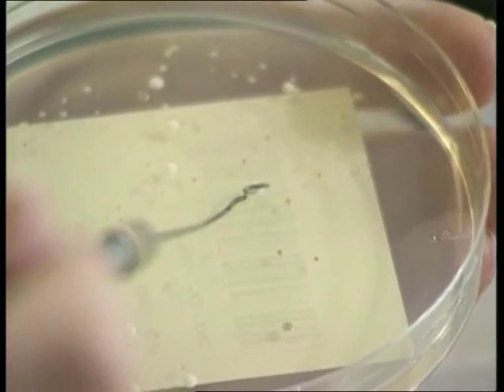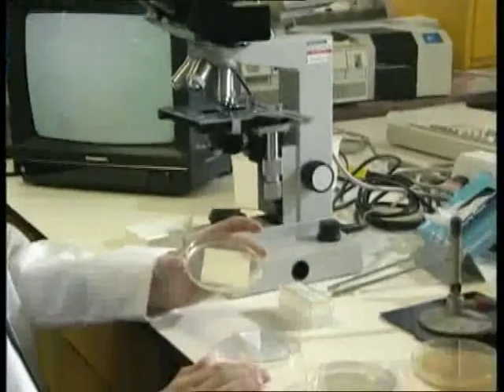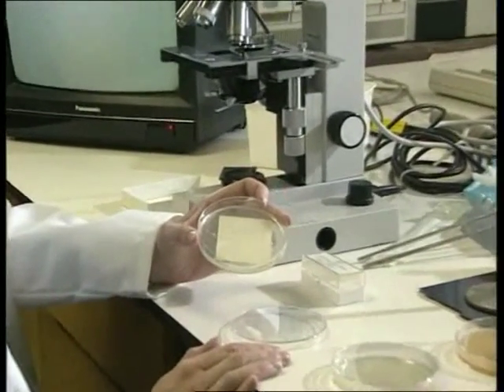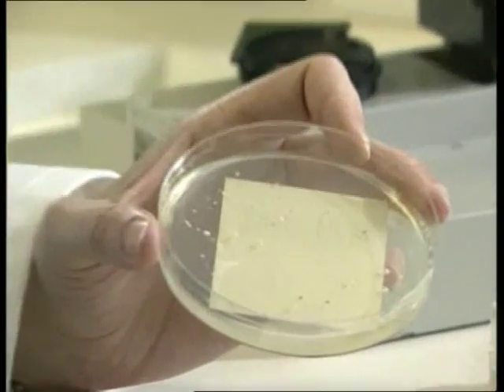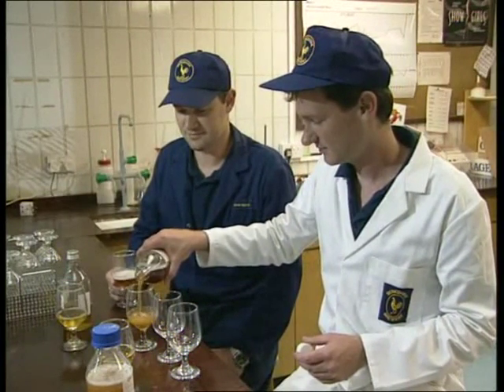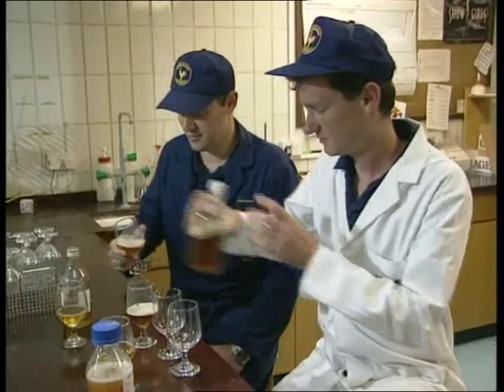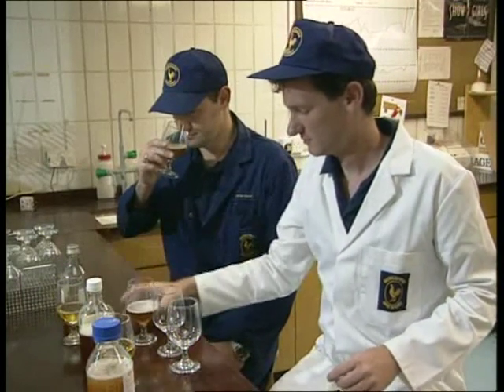These are wild yeast growing on this specific copper medium. There shouldn't be any wild yeast in the brewing process. This demonstrates to me that we have a problem in a road tanker that we've received from another site — we have wild yeast contamination. It is of paramount importance that you have the right yeast to brew the beer that you're brewing, because the yeast adds characteristics to the product, hence you get different beers tasting differently.